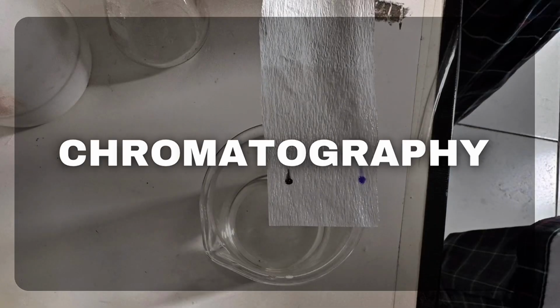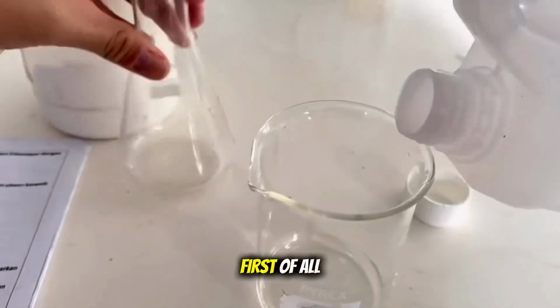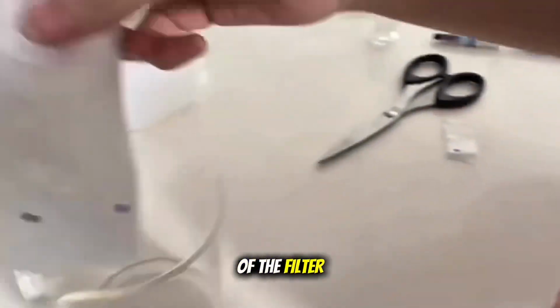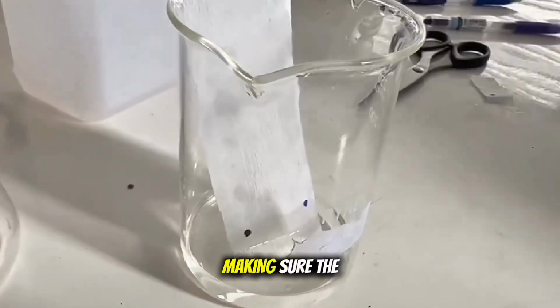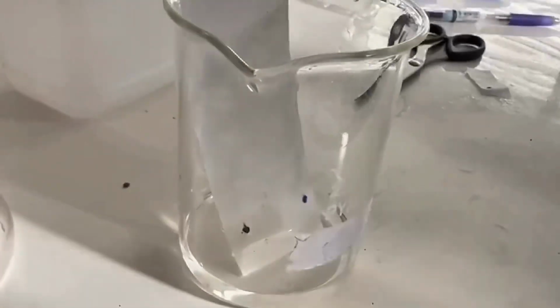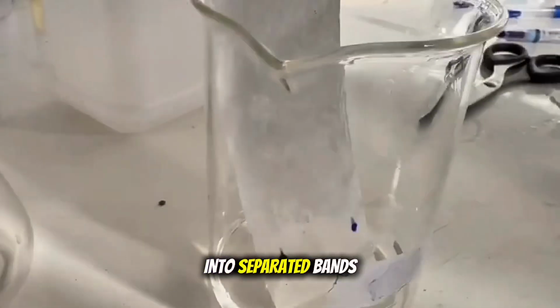Chromatography. The tools are filter paper, a glass, and water, and the material is black ink. First of all, pour alcohol into the beaker. Draw a spot of black ink near the bottom of the filter paper. Then place the paper into a glass with a little water, making sure the ink spot is above the water line. As the water rises through the paper, it carries the ink. The different colors in the ink move at different speeds, so they spread into separated bands.